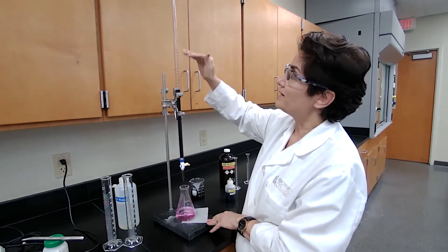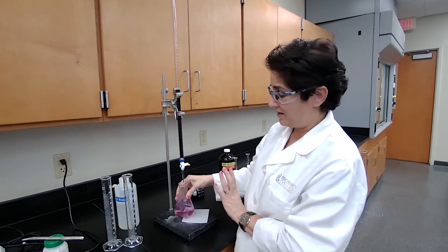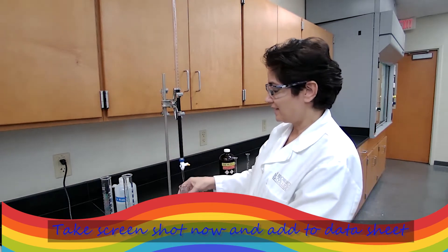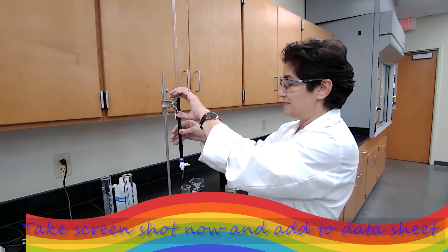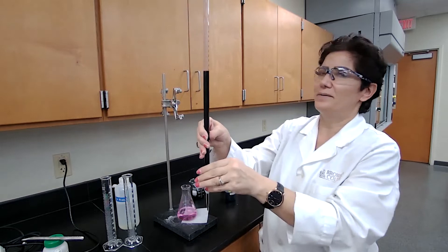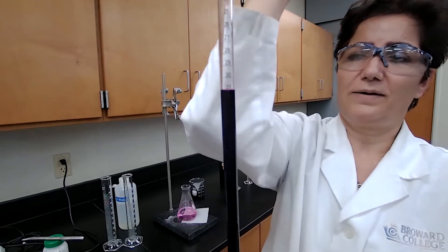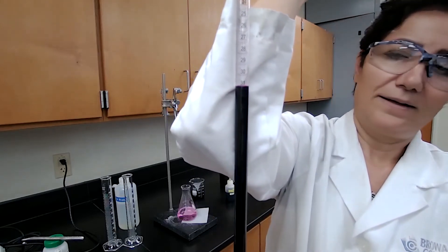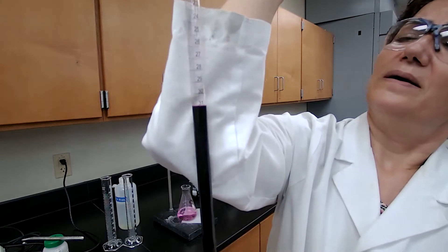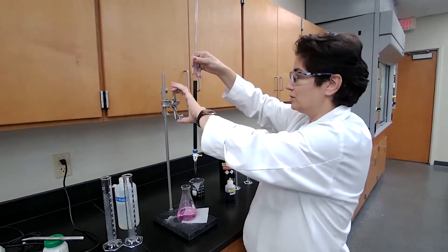The camera was paused while I was adding permanganate. Now the pink color is stable — if it stays for 20 seconds, that's the end point. Please record the volume from the burette. I'm holding a white background so you can read it clearly. This is the final buret reading for Trial 1.